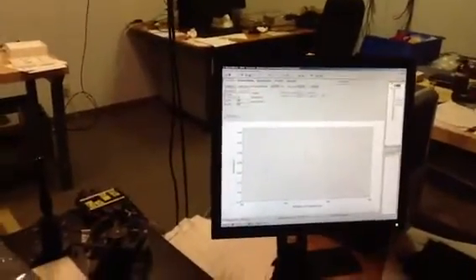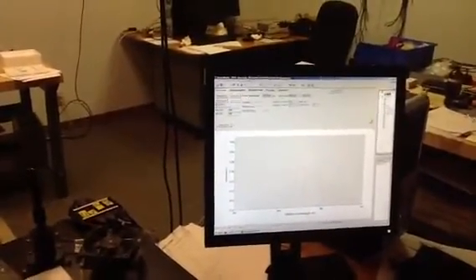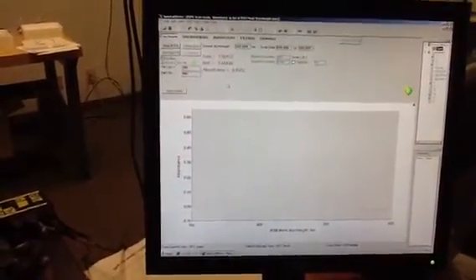Now, these spectra will be collected at a normal scan rate, actually, there's the answer there already. That's the holmium oxide filter that we're going to be collecting. But here we're doing it real-time, and you'll see the spectra come in nanometer by nanometer.